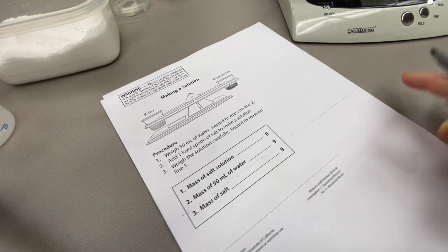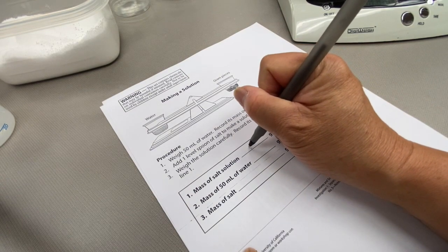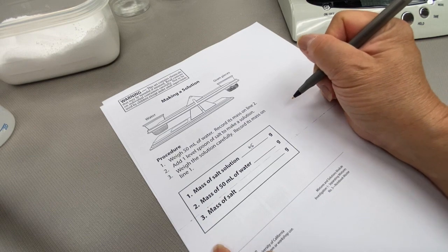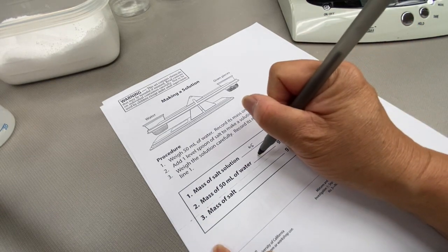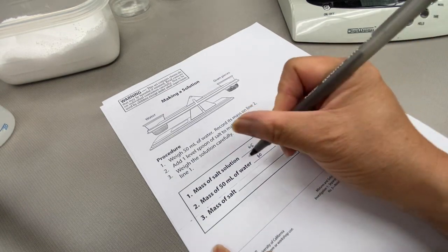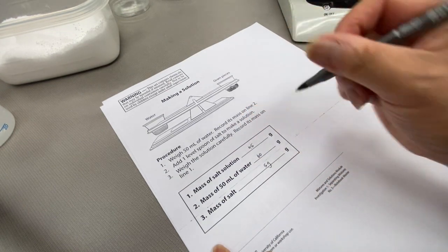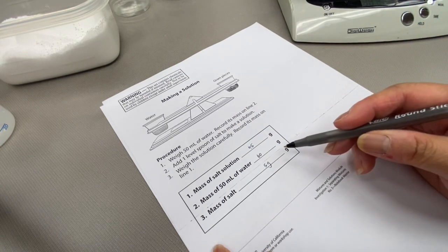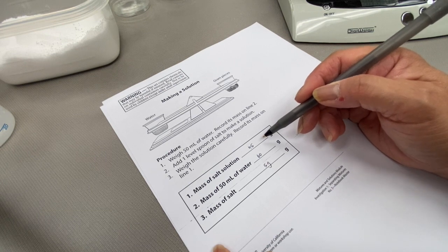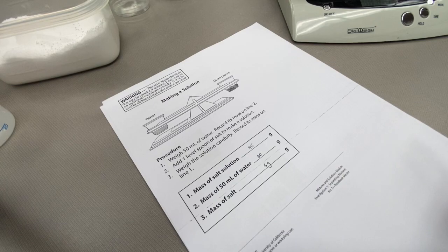So let's look at our data sheet. Our salt solution weighed 65 grams. Our water and cup weighed 60 grams. That means that the salt inside of our cup weighed 5 grams. So the salt did not disappear — it's still in there, and it does make the weight of our cup 5 grams more.